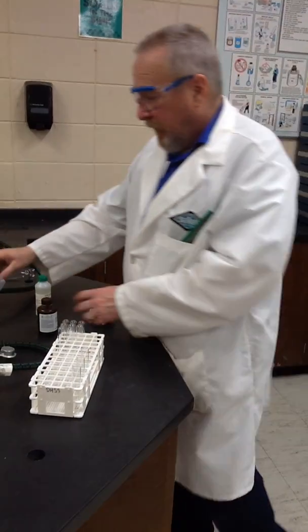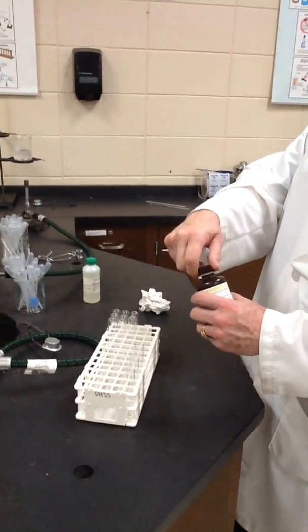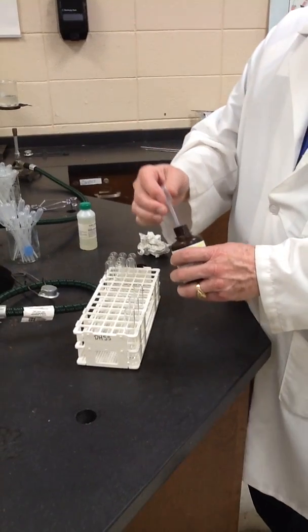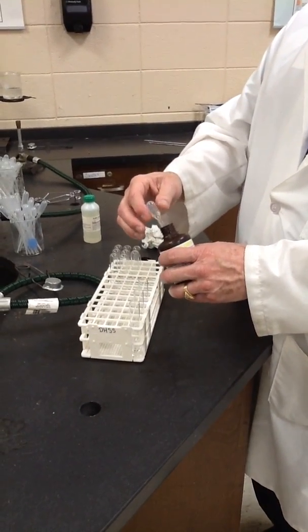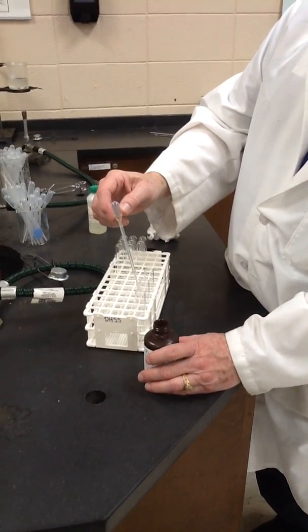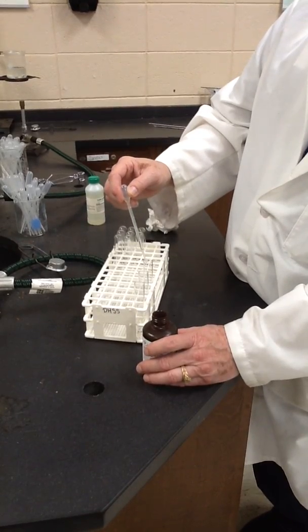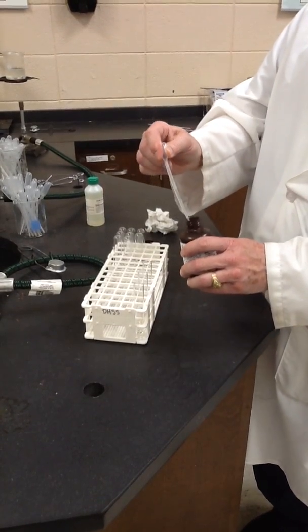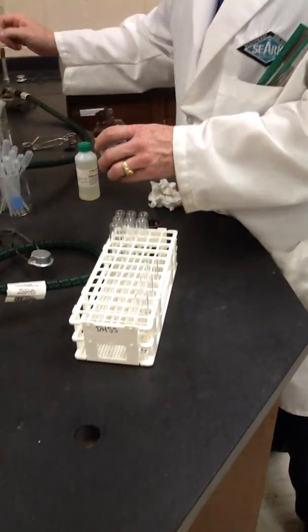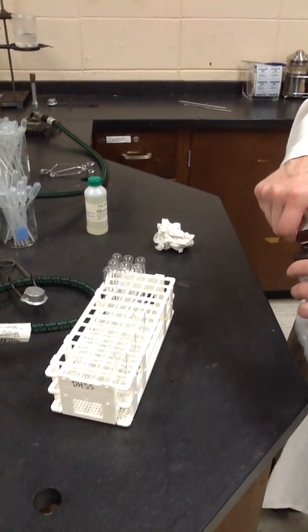Next we're going to add a drop of nitric acid. You want to be extremely careful with this very reactive acid. It's become slightly discolored over time. I see it smoking as I open it up, even though it's half strength. 1 drop in each tube. And you can see the tubes have already reacted. You can see some color change in them.